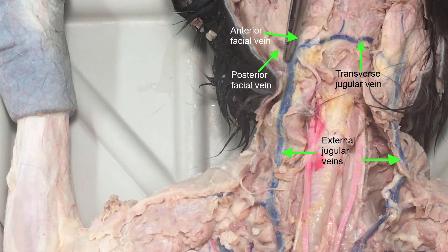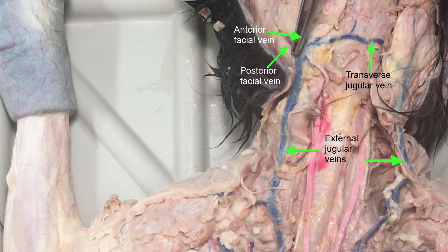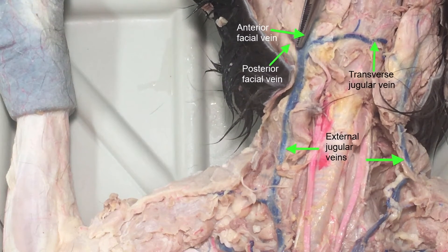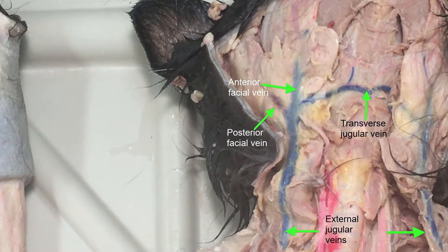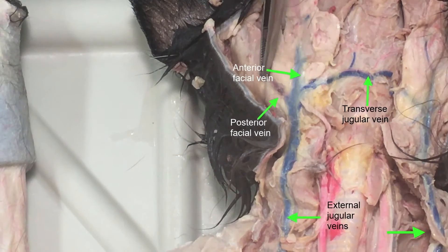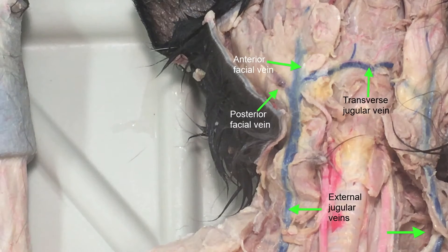Now we're going to look at some blood vessels here in the neck. This is the external jugular on the other side, and you can see this very nicely stained transverse jugular — it's not always stained so well. A lot of the blood vessels aren't always stained well up here because this is where they actually do the injection. You might see little knots tied at the injection site. Sometimes the latex doesn't always loop all around in here, but it did for this cat. So this is the transverse jugular. And then you have some branching nearby — these are facial veins: this is the anterior facial vein and this is the posterior facial vein.